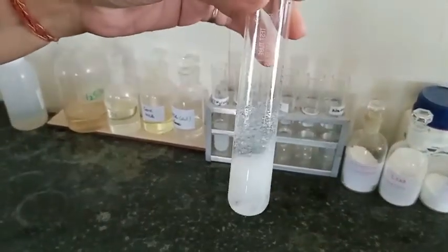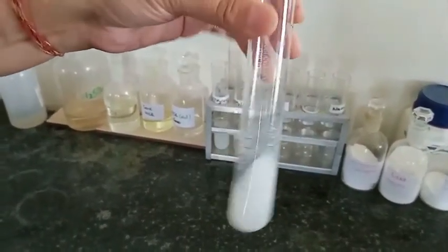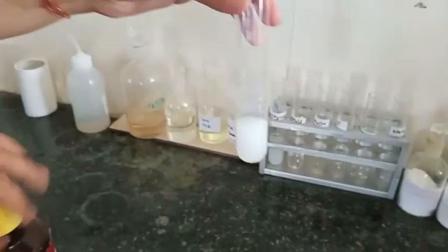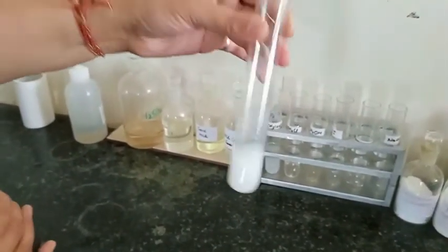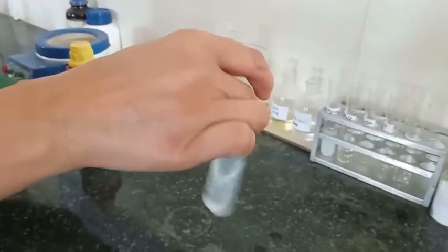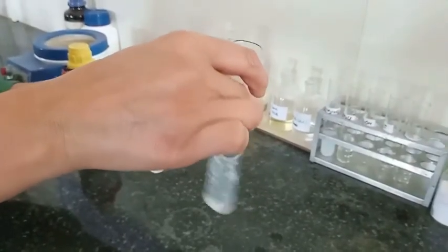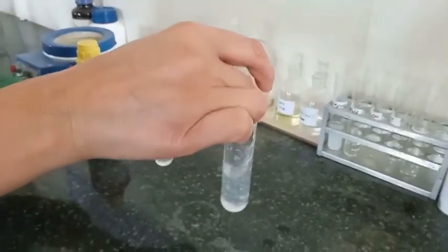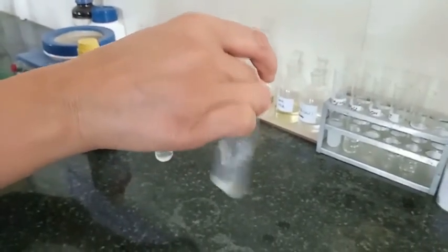Now we add the next group reagent, that is ammonium chloride and ammonium hydroxide. We get a gelatinous white ppt, which suggests the presence of aluminium. We get a ppt of gelatinous nature — this is a clear indication of the presence of aluminium. This is how you go for the test for the presence of that particular group element.